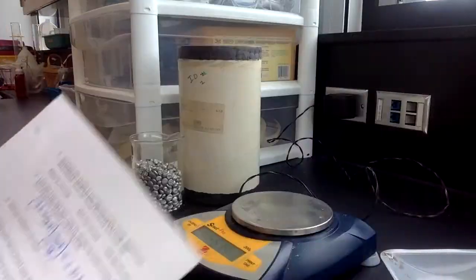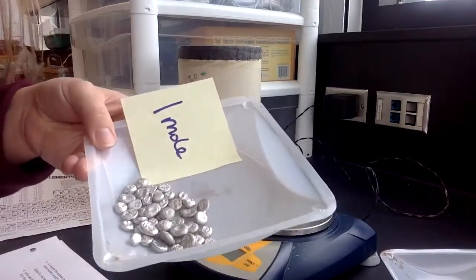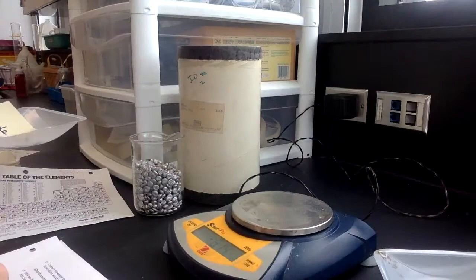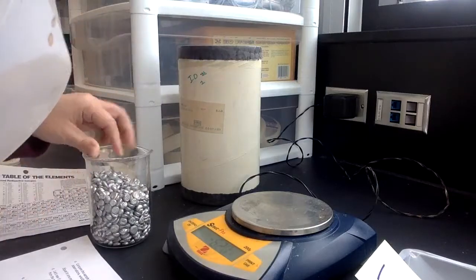All right, so now we've got this idea. Oh yeah, because 1 mole was about 26.98 grams, right? And then this, remember, was 35. So it makes sense that that was a higher gram sample. Okay, and then it says that I can place this sample back into the beaker. So I'm done with that one.